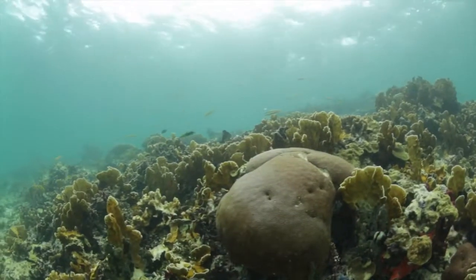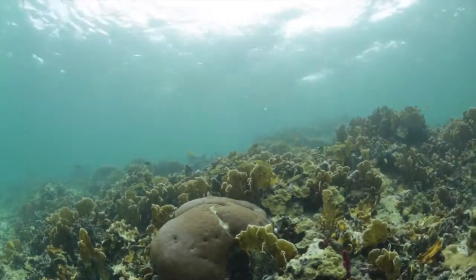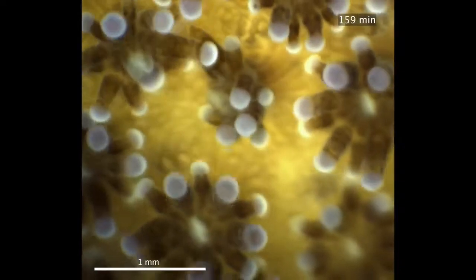So while coral reefs are very large in size and can span kilometers, the individual organisms that actually build those reefs are coral polyps, which are only a millimeter approximately in size. So corals compete for space on the reef. If they grow close to each other, they'll fight basically for that space.